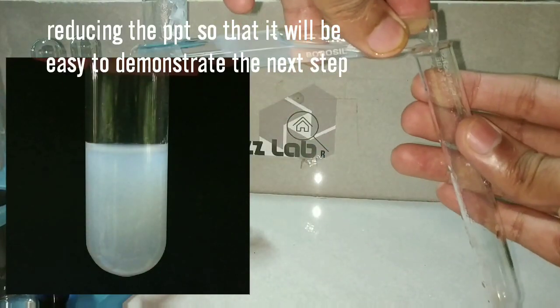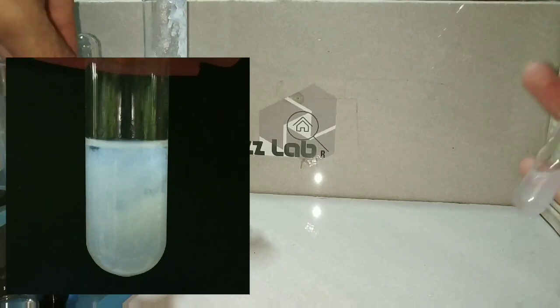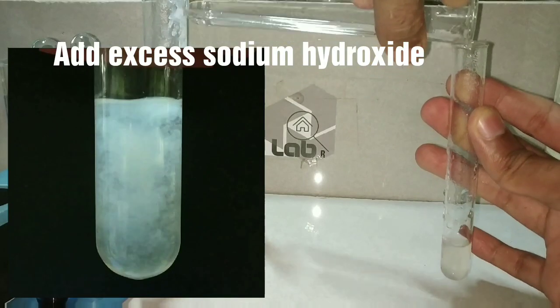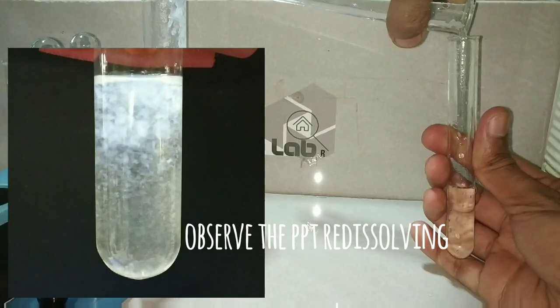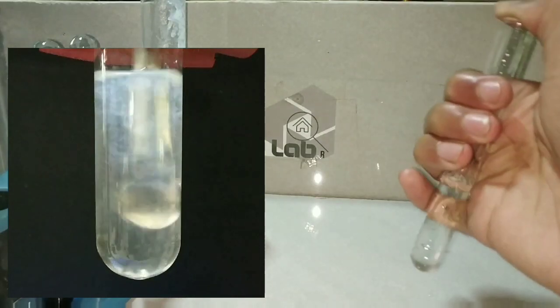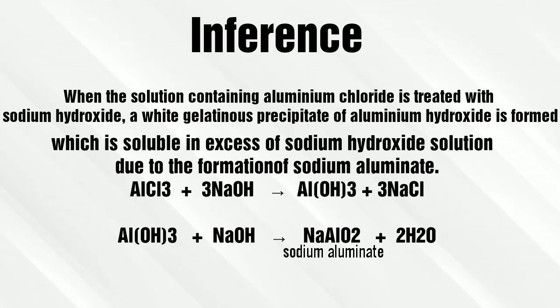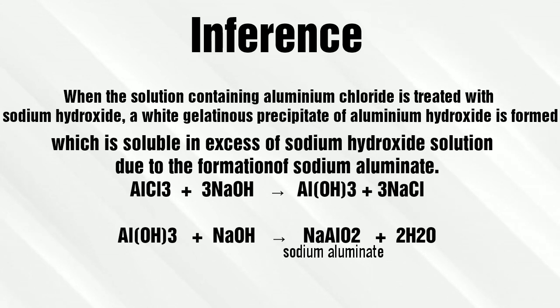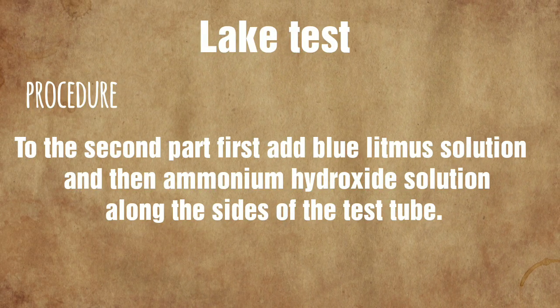Now I will be reducing this precipitate so that the next step would be much easier. The next step is to add excess of sodium hydroxide into the precipitate. You can see that on adding excess of sodium hydroxide, the precipitate starts to re-dissolve. On mixing well, finally we got the clear solution. Initially Aluminium Hydroxide was formed, which was the precipitate, but on adding excess of sodium hydroxide, the precipitate dissolved due to formation of sodium aluminate. Now we move on to the second confirmatory test.